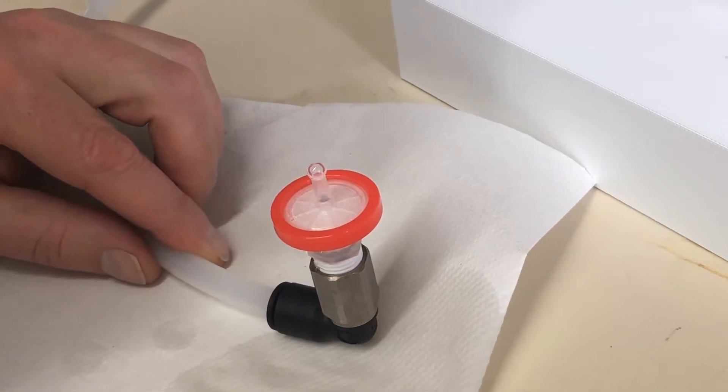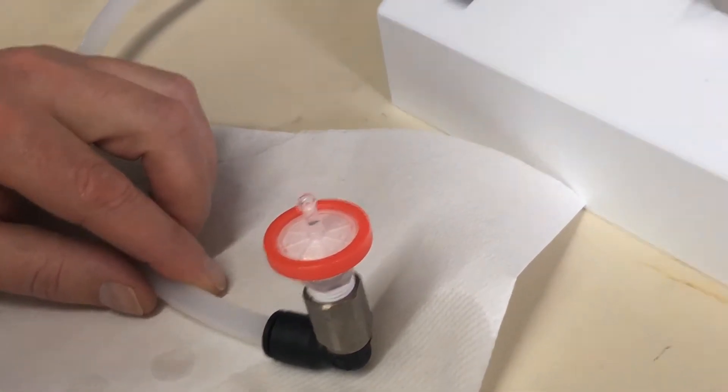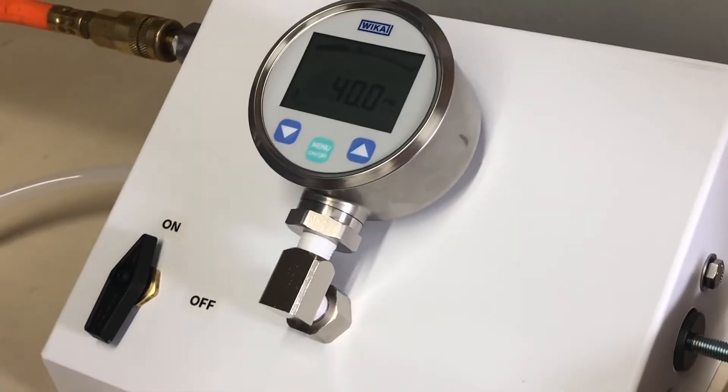So that's the water entry point. It was about 40 psi.